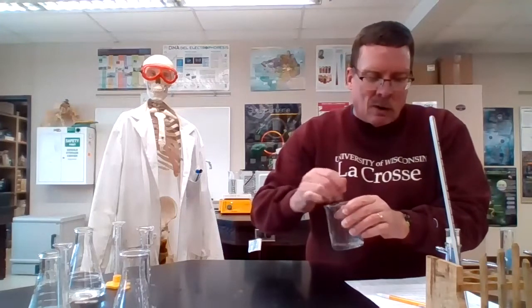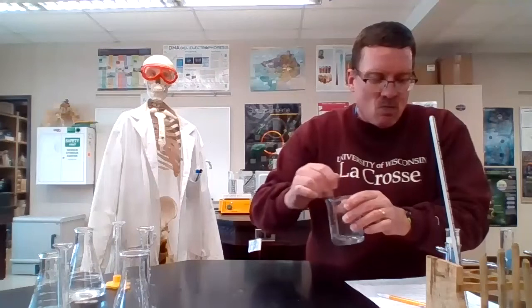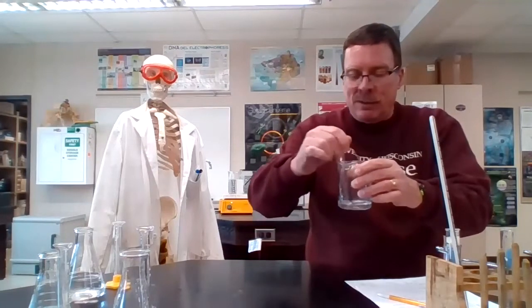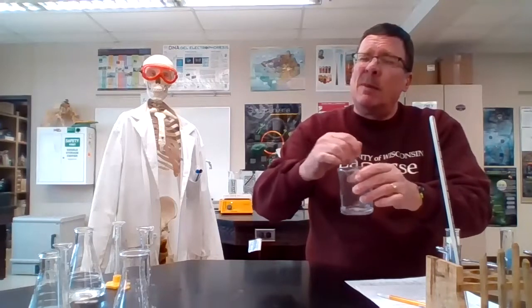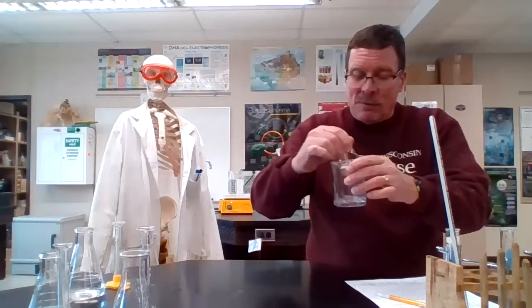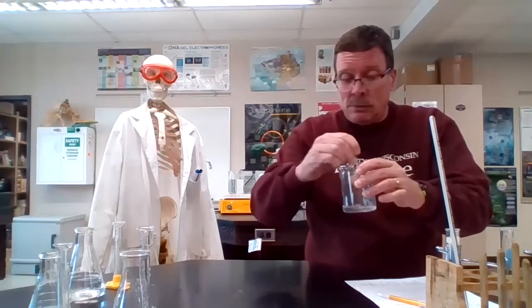Now, our room temperature, 20 degrees, was 70 seconds. And our 5 degree was 2:37. So we're at 1:10 versus 2:30. This will hopefully be somewhere in between. You certainly feel free to make a guess, but again, no wagering, ever. Illegal.